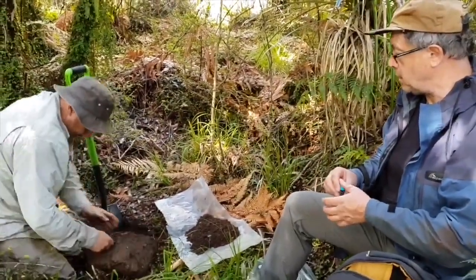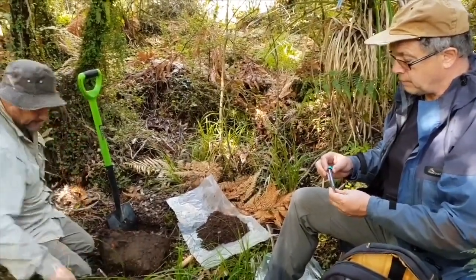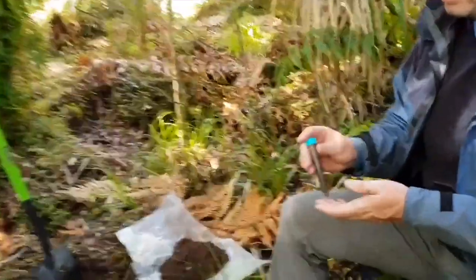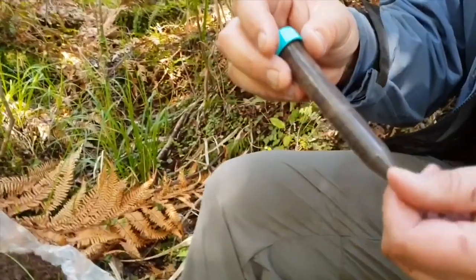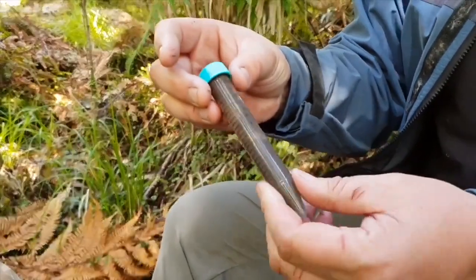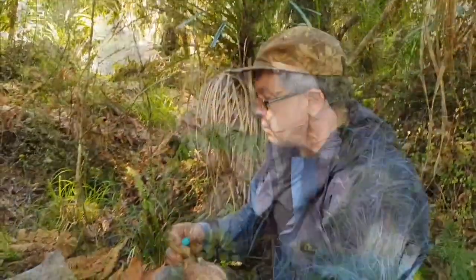What we're doing here is sampling the organic topsoil and the mineral topsoil for DNA and RNA extraction to look at microbial communities and also function in terms of enzymes. We have a preservative solution pre-weighed before we come to the field, and we put approximately two grams of soil in — it basically stabilizes the DNA and the RNA so we don't have to freeze things.